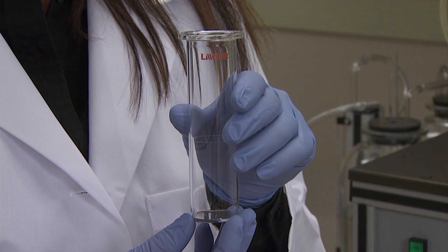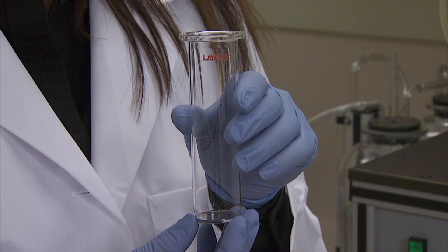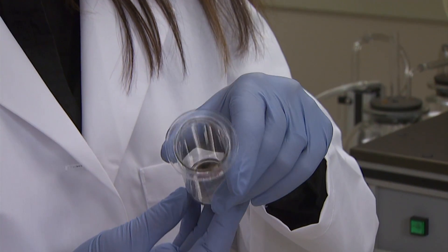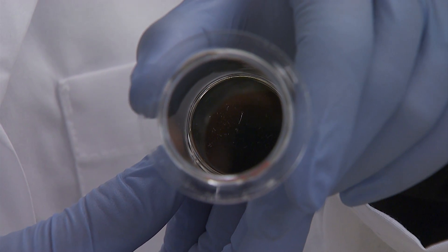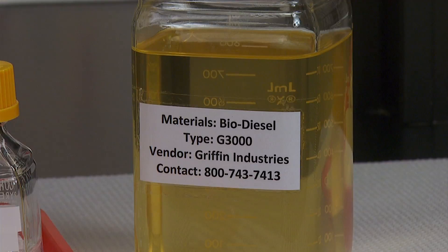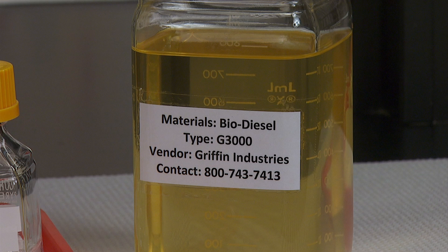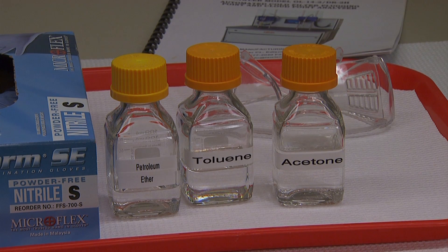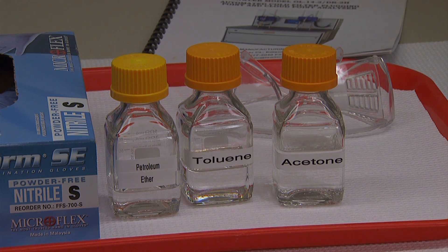The test jar is a clear cylindrical glass with a flat bottom, marked with a line to indicate sample height 54 plus or minus 3 millimeters above the inside bottom. The mirrored surface on the bottom makes automatic cloud detection possible. A fuel with a cloud point similar to the expected cloud point of the sample may be used as a standard for instrument check.